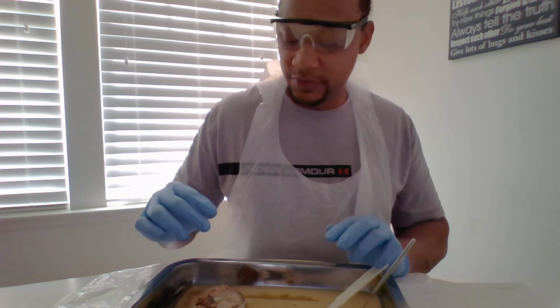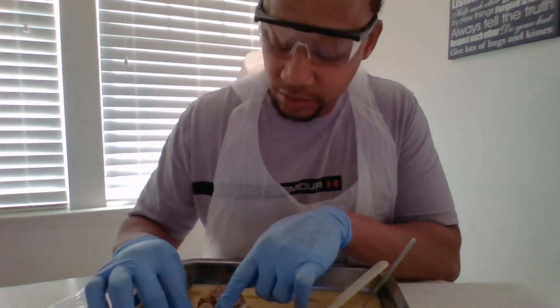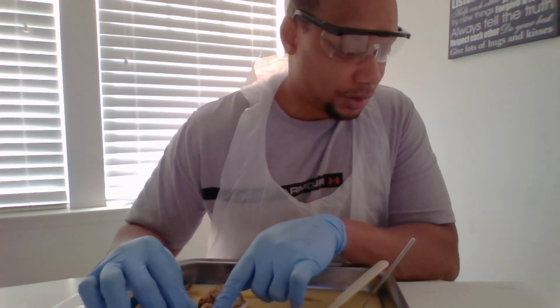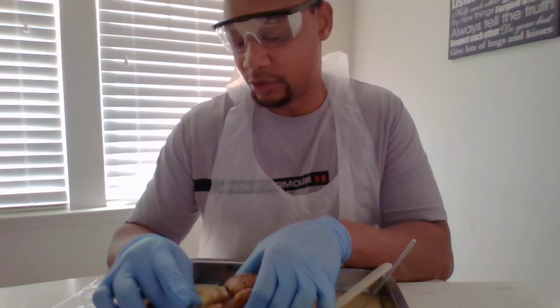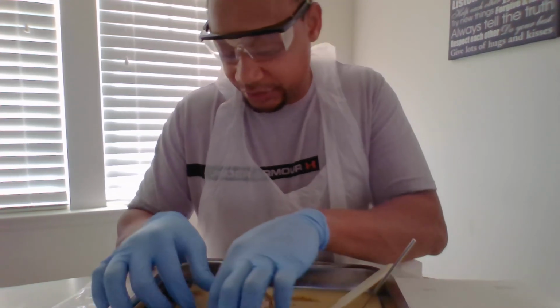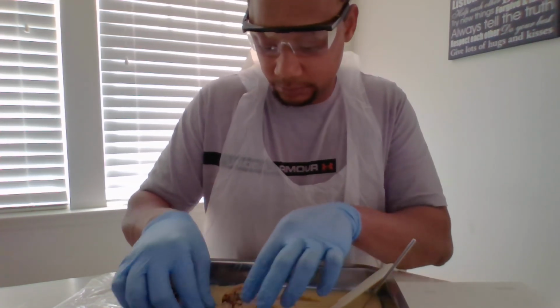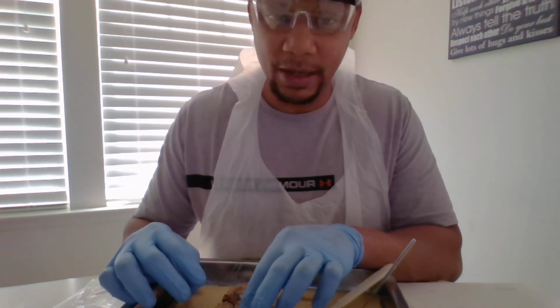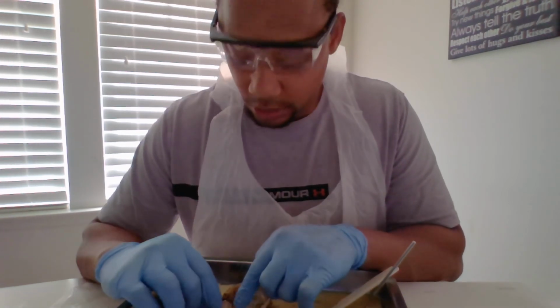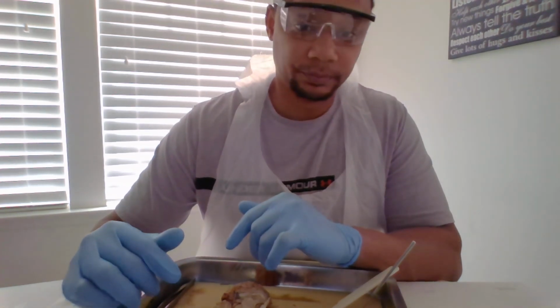For your arbor vitae, that's these tree-like or branch-like things on your cerebellum. And then finally, your spinal cord, which is back here. I think it's easier to show you the white and gray matter in the cerebellum. The gray matter is the functioning part, and the white part is what connects all of the gray area, and that's basically right here. And that's it.